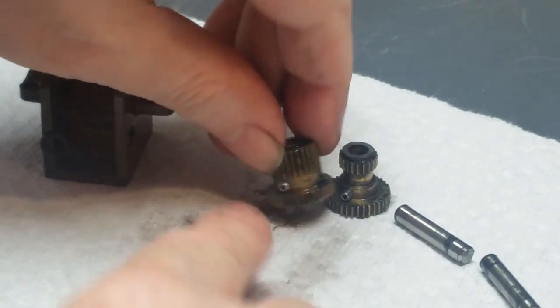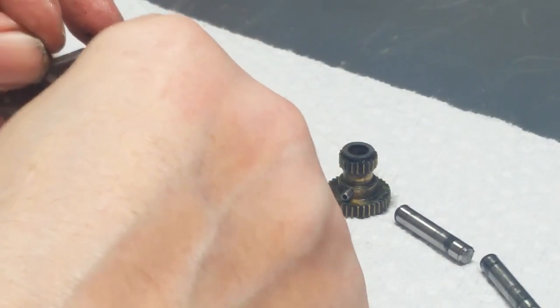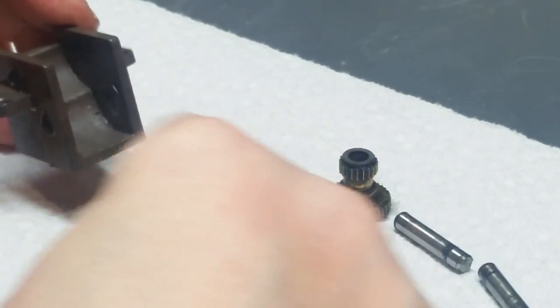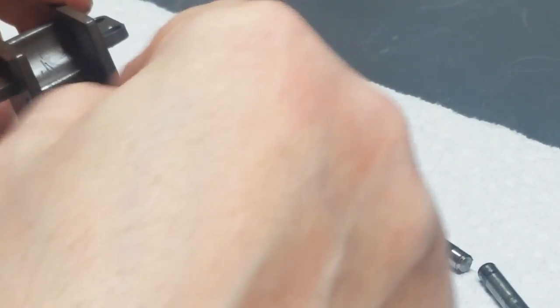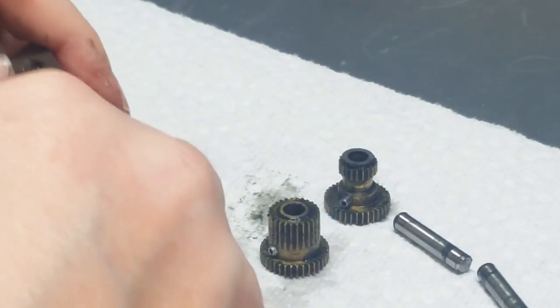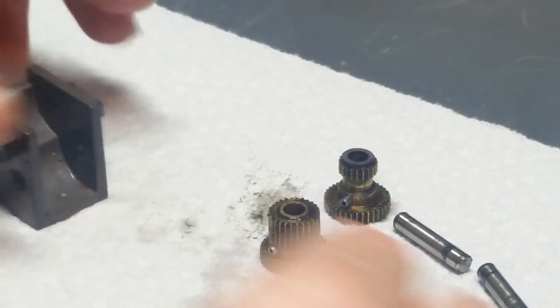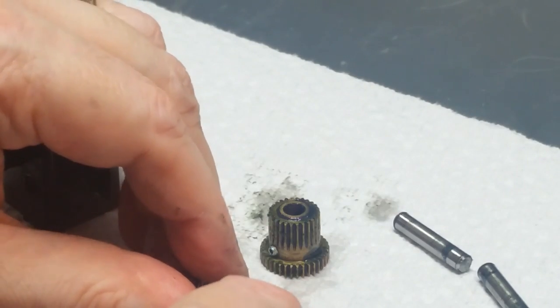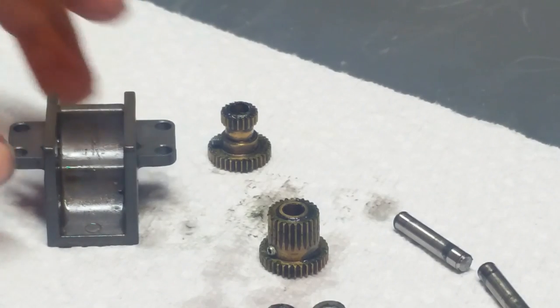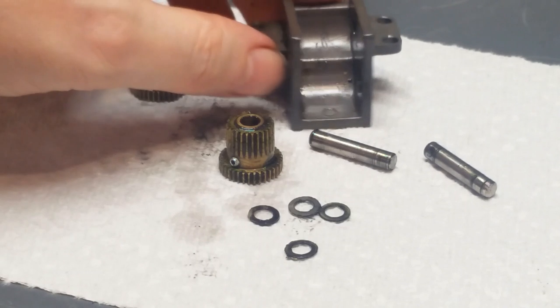There's still a set screw in each of these, and there's four of these little nylon thrust washers. Basically they're located on the ends of the gear, between the gear and the housings, to give them a smooth ride. So I want to remove all of those, make sure they're all accounted for. There's three. And one snuck out on the gear. And four. Okay, I'm going to do the same thing. I'm going to go off camera, clean up this mess, and be back shortly.